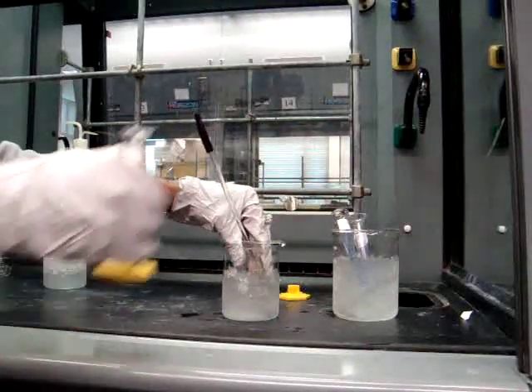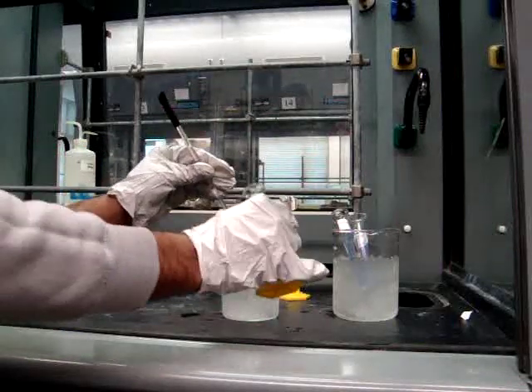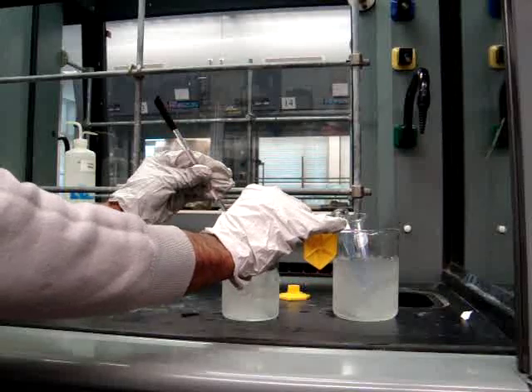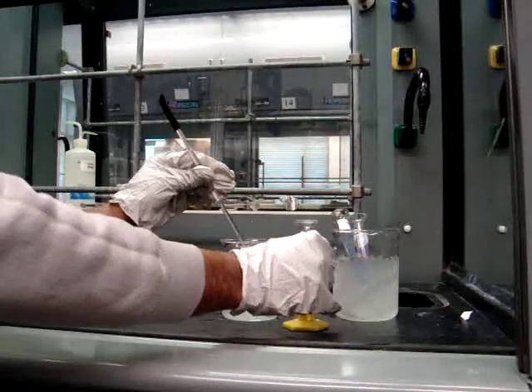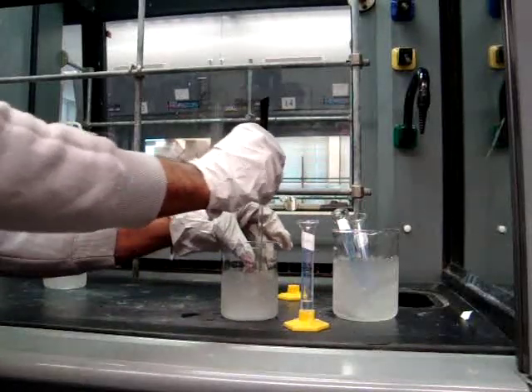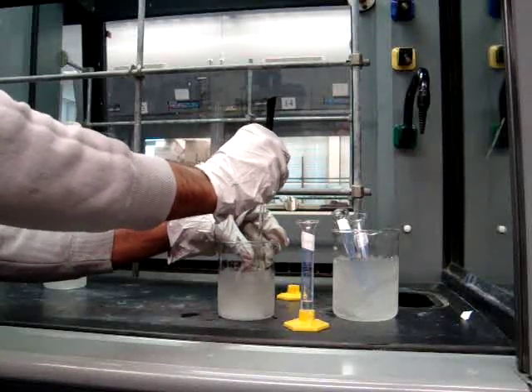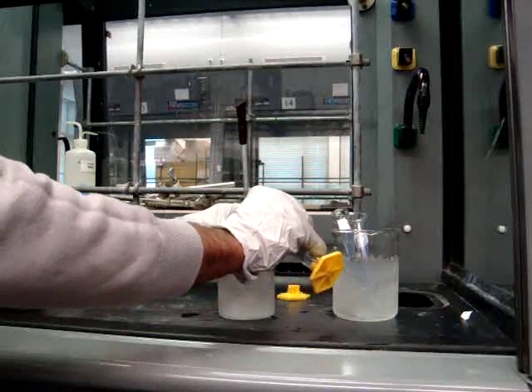So this is your solution. You'll be adding the nitric acid slowly to the cool 3 mL of sulfuric acid that are already in the 50 mL flask. Make sure that you use a glass rod to stir in the beaker, which will help the formation of the nitronium ion.